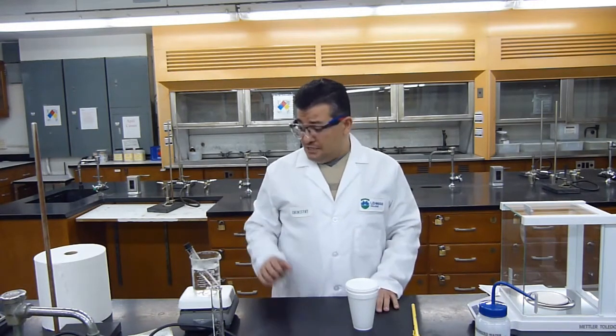Okay, so we're back. It's been 10 minutes. The metal's been sitting in boiling water for 10 minutes. So now the initial temperature of this unknown metal should be 100 degrees Celsius. We're going to assume it's 100 degrees Celsius because it's been sitting in boiling water for 10 minutes. So all of the thermal energy that was in the water transferred to the metal. Since water boils at 100 degrees Celsius, that same energy is now transferred to the metal, and the metal has 100 degrees Celsius initial temperature.